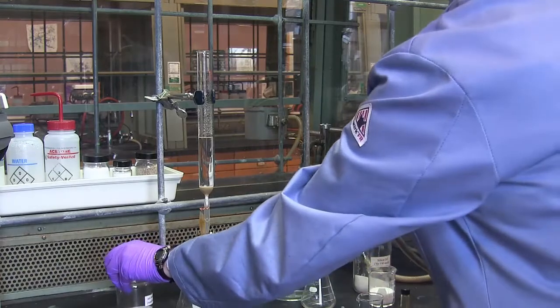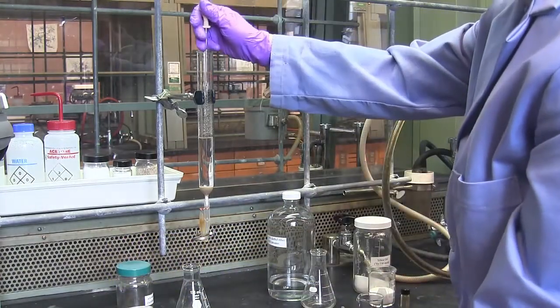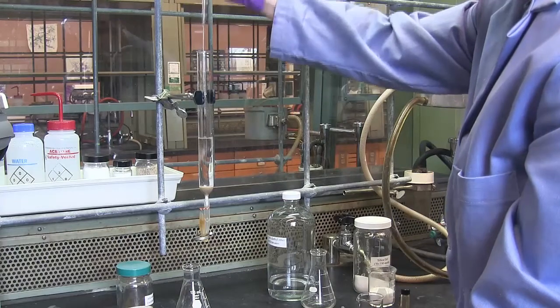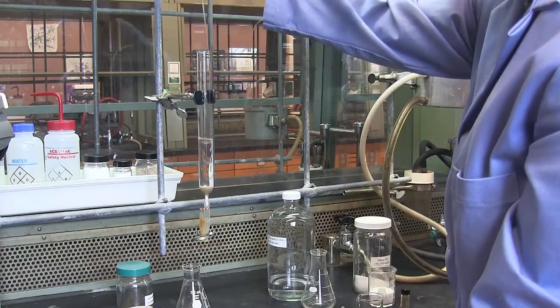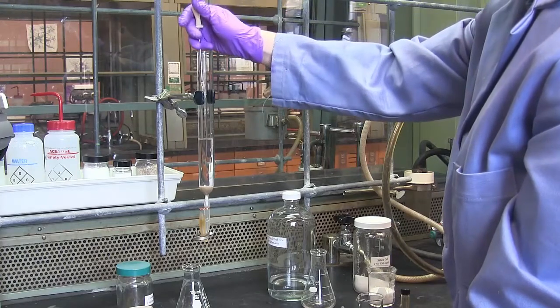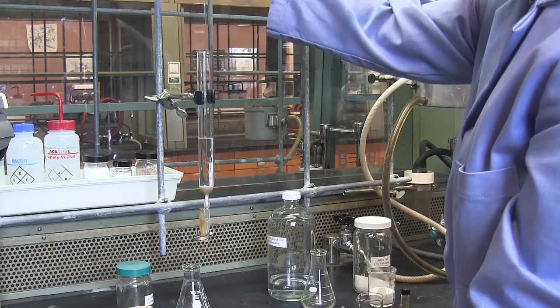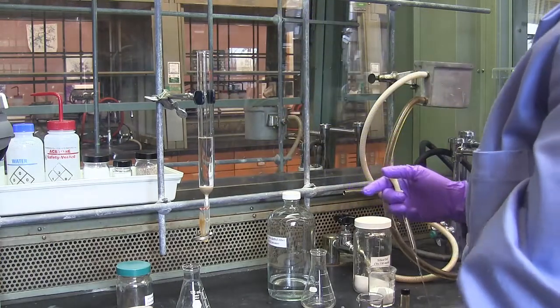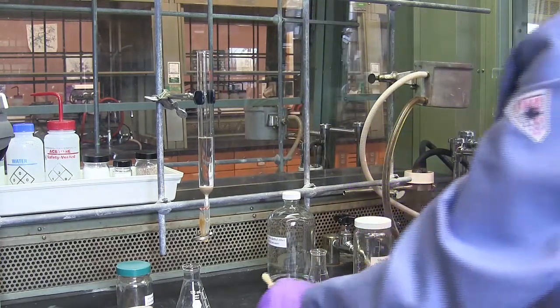Sand will likely stick onto the glass at the top. You can use some fresh solvent to rinse that down. You want to be careful if you use a pipette to rinse the column to make sure that you don't torque the glass. The glass is pretty weak and can snap off and then the pipette will drop down into your column. That is not a professional look.